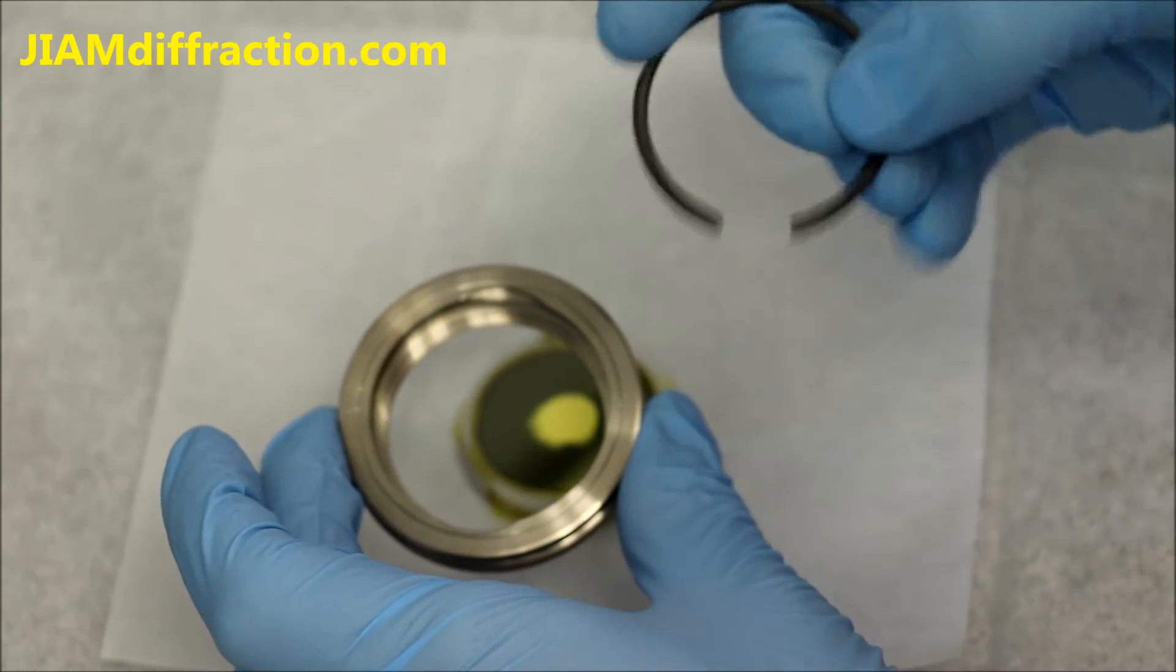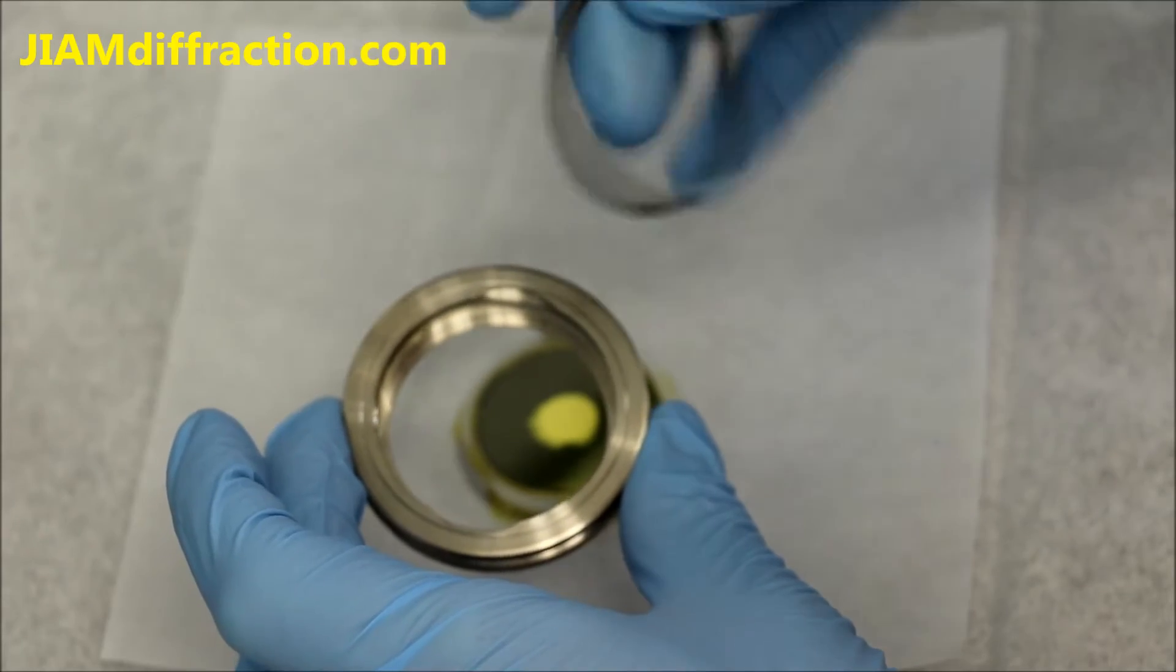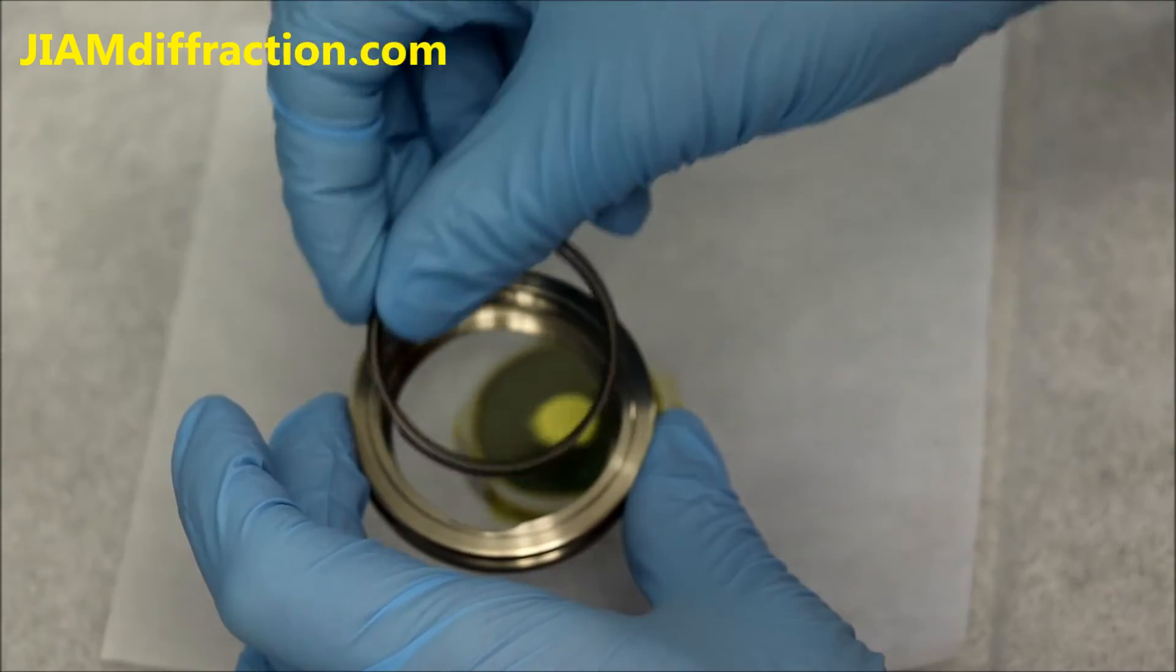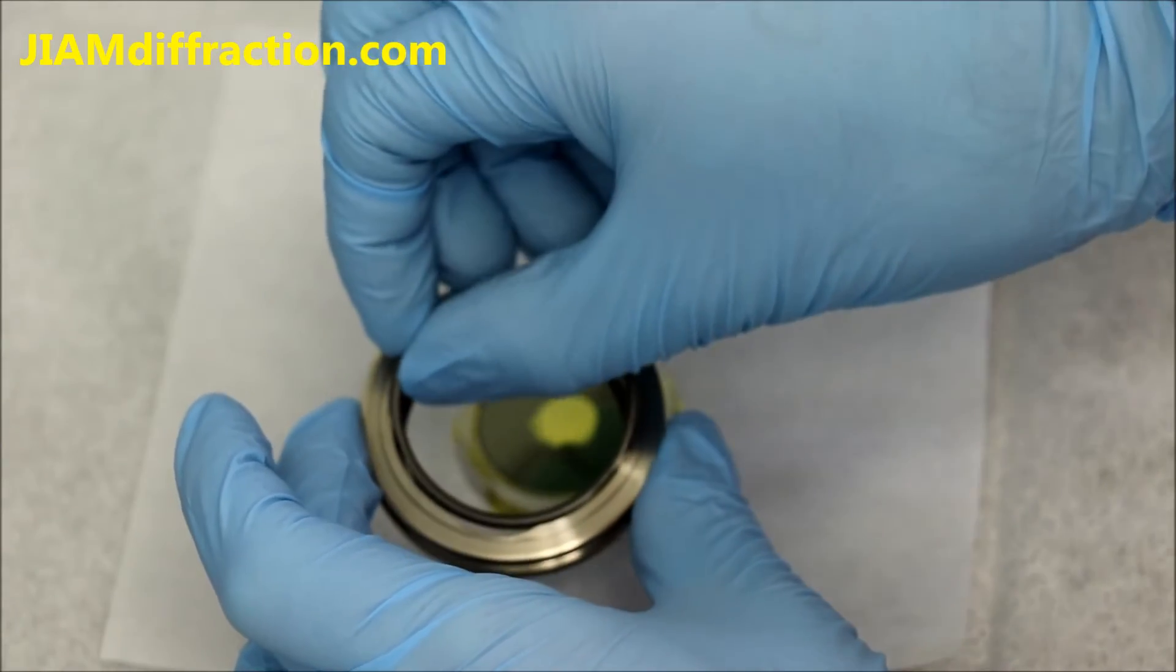Now this has two notches, this has some flat pieces to it. I suggest trying to make sure that at least one of these notches doesn't line up with a flat piece. So just like that.